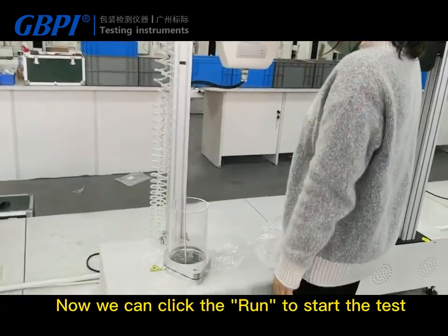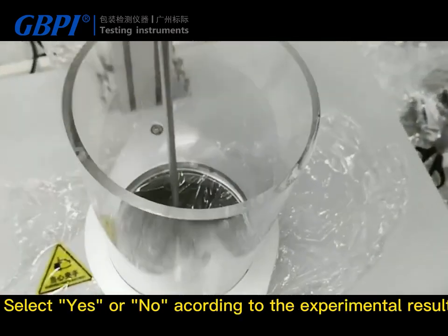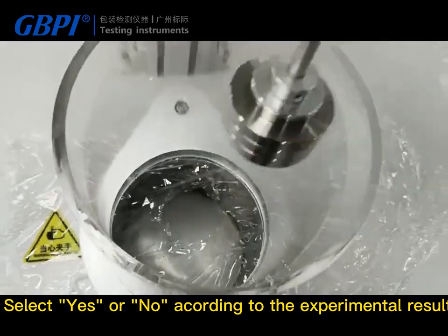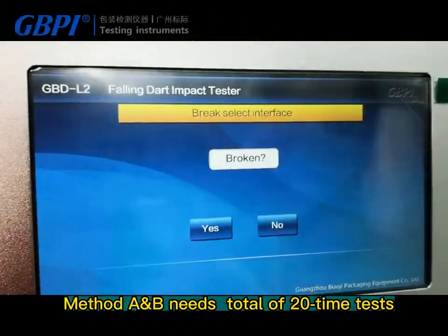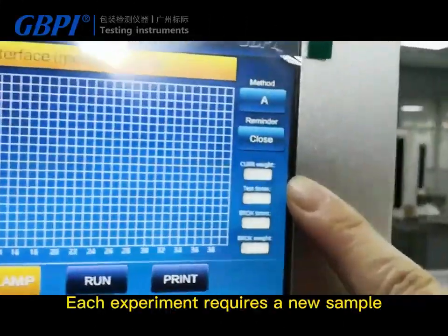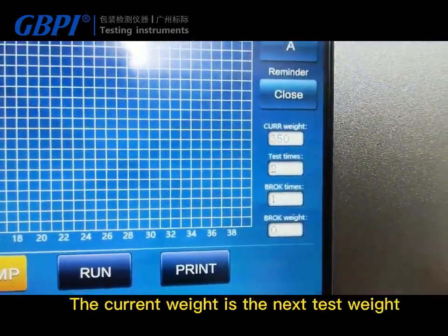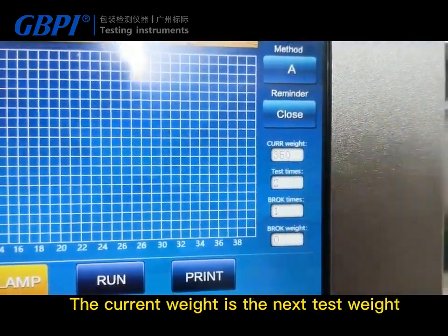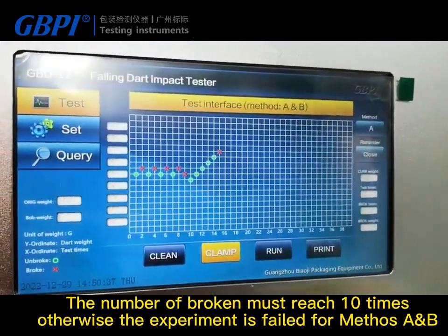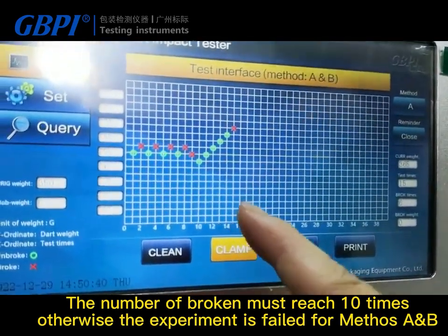Click Run to start the test. Select yes or no according to the experimental result. Methods A and B require a total of 20 tests, and each experiment requires a new sample. The current weight shown is the weight for the next test.